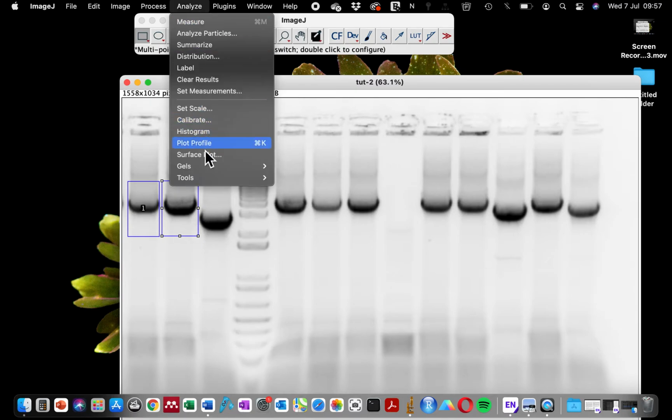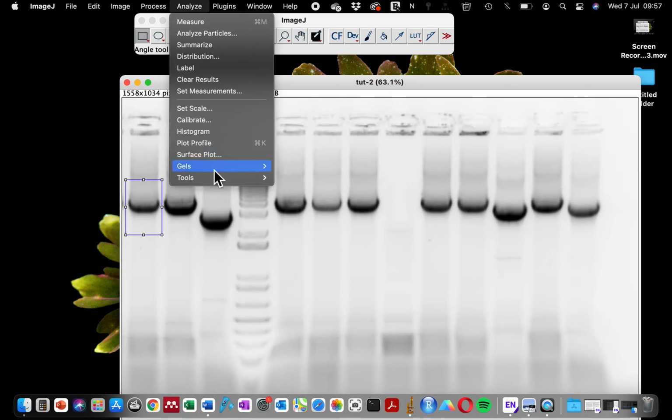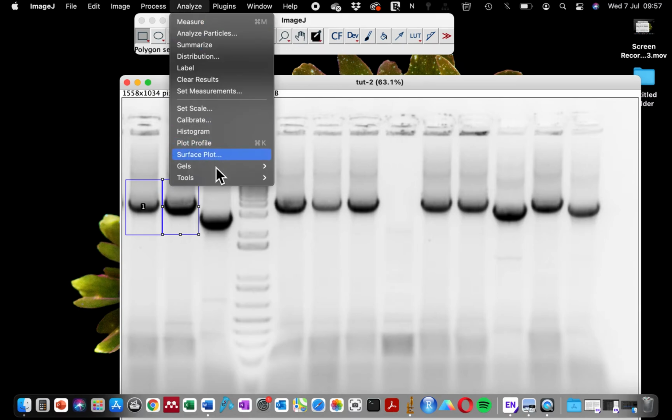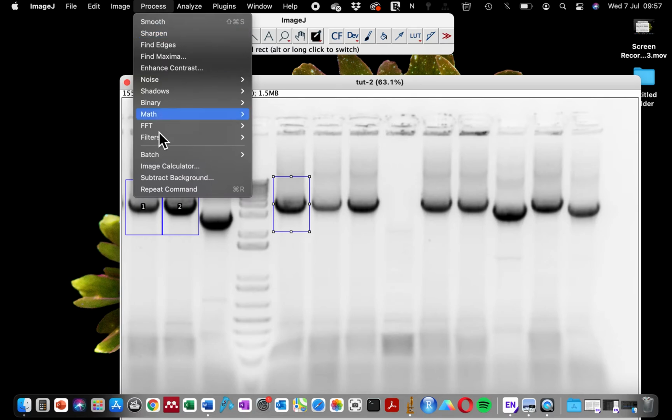So I will just go to gel and reset, so that way I can start afresh. So I'm going to select the first lane again, drag this to the next one to select our next lane. Note, if you select first lane again, it will override the selection of the first lane, and that's why you have to use select next lane. I'm going to do this for four different bands.